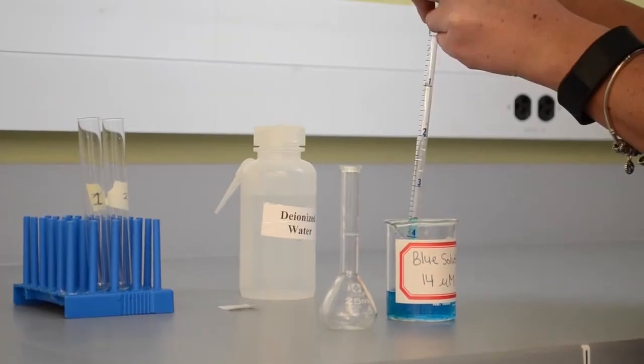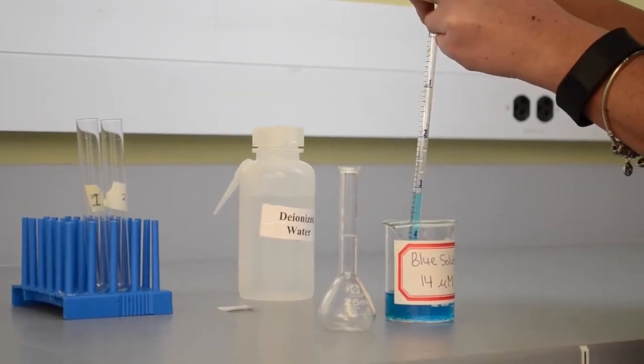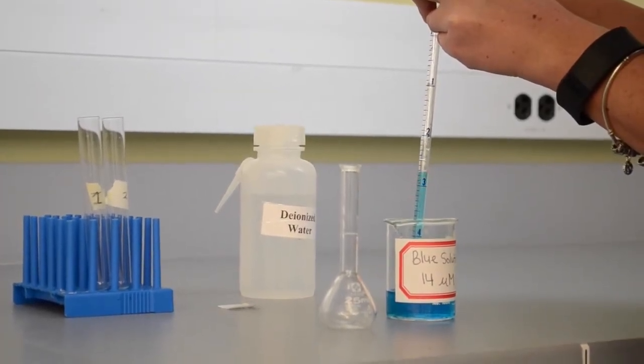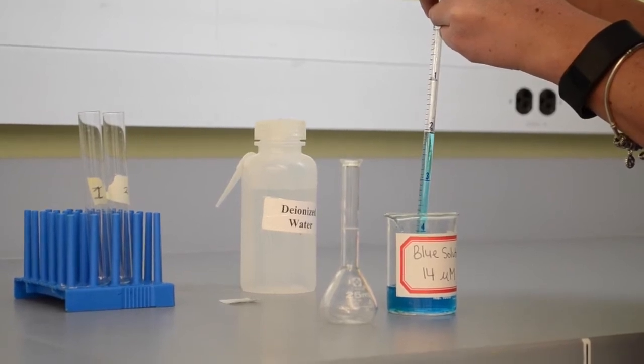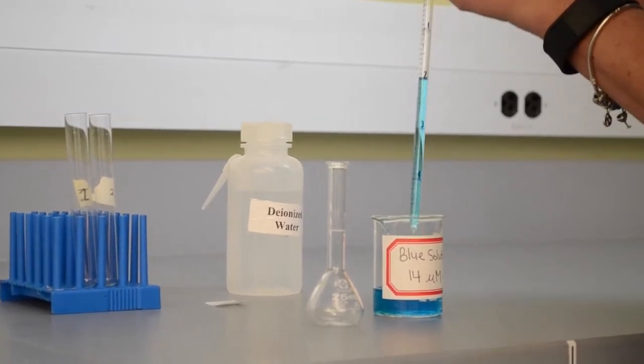The blue solution will be added first. We draw more liquid than we need in order to get a more accurate measurement. In this first dilution, one milliliter of solution will be taken.